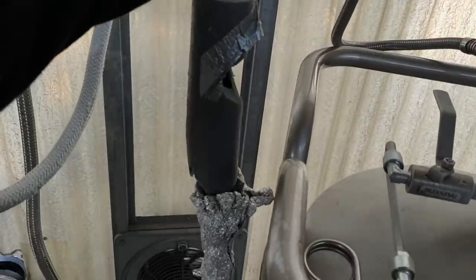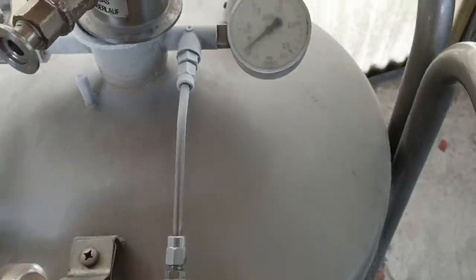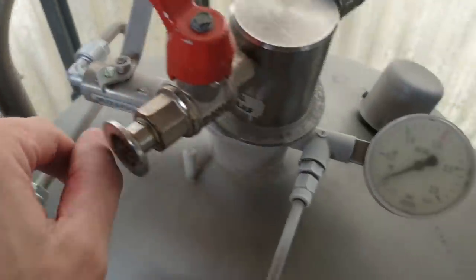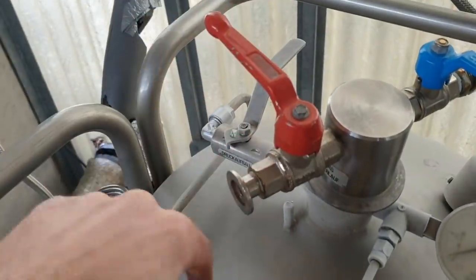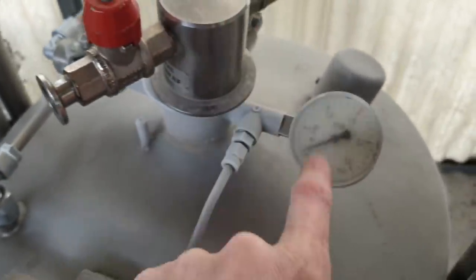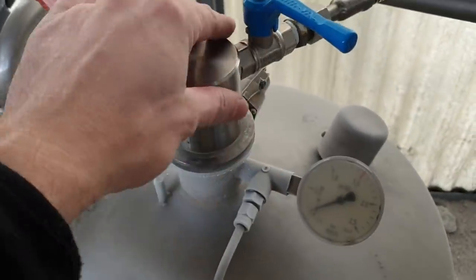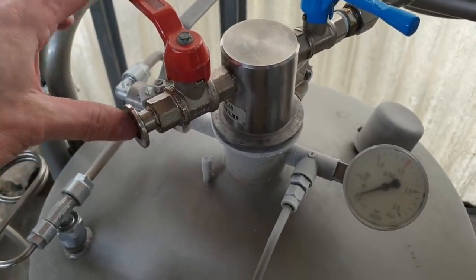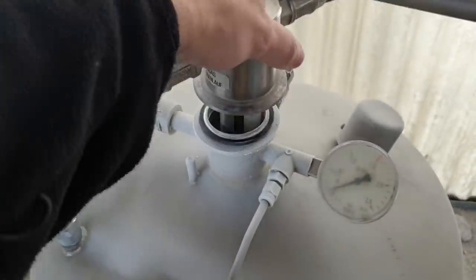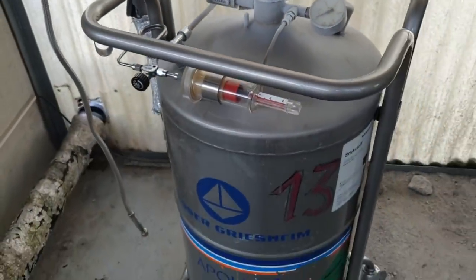This is just basically a miniature version of that — it goes to the huge tanks outside. You can just about see where the main storage tanks are. You get a little bit of pressure from this valve, and that's what you've got to open if you want to vent the chamber so you can take the top off. If you try and open this while you've still got a bar of pressure in there, this thing will shoot off. And that is how you fill one of your big liquid nitrogen dewars.